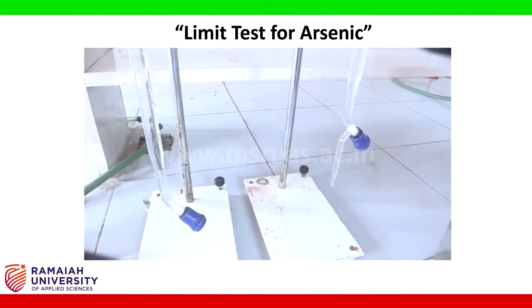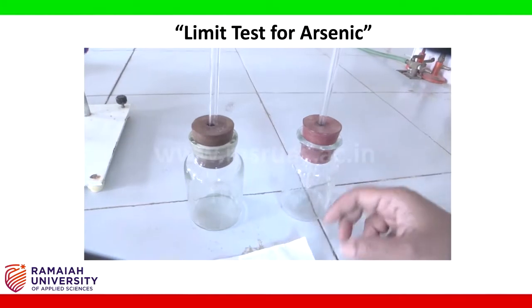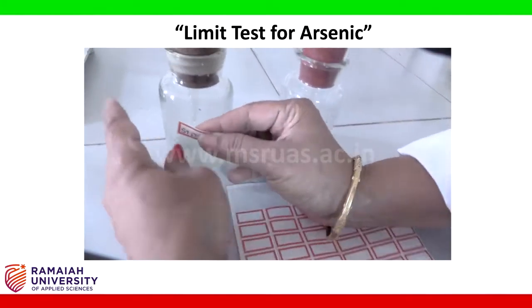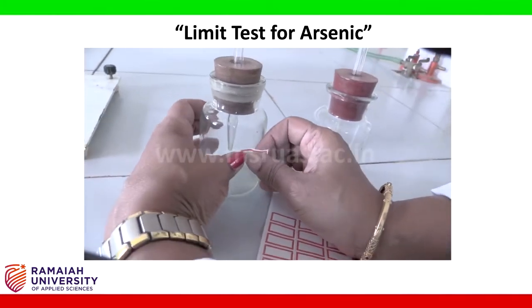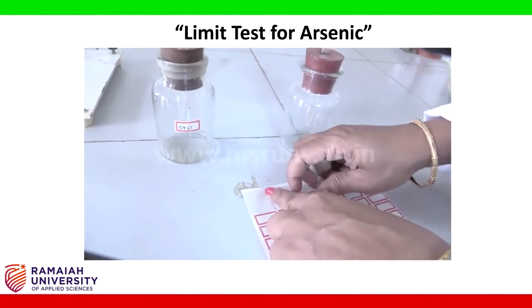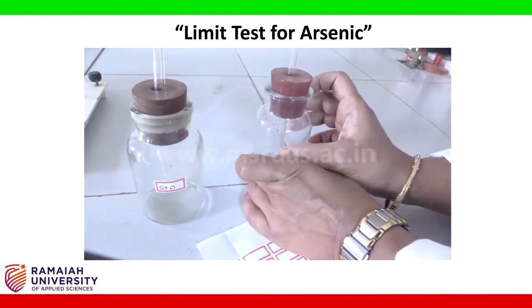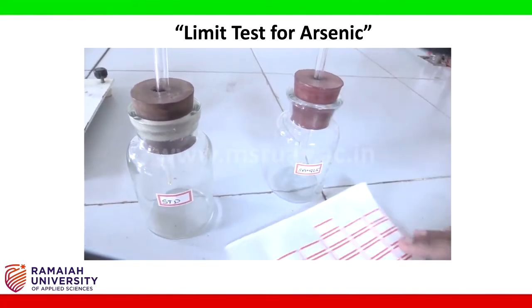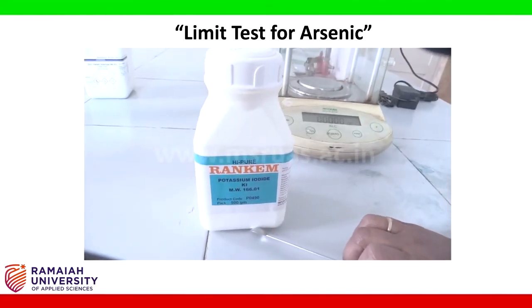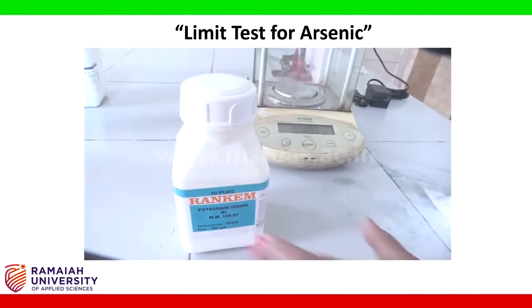After filling the burettes with the respective reagents, now we will assemble the arsenic apparatus. Label one apparatus as standard and another apparatus as sample. Next, we will weigh potassium iodide for the experiment, 1 gram for the standard solution and 1 gram for sample solution.